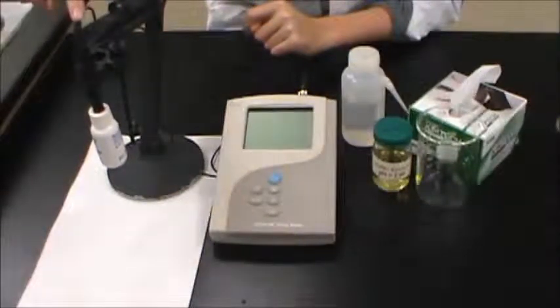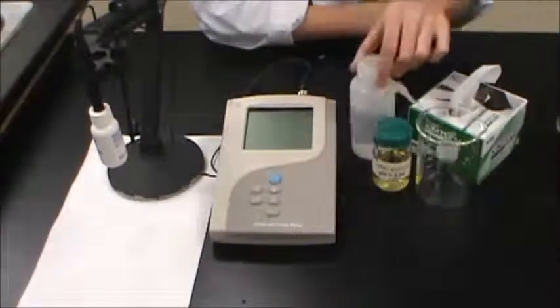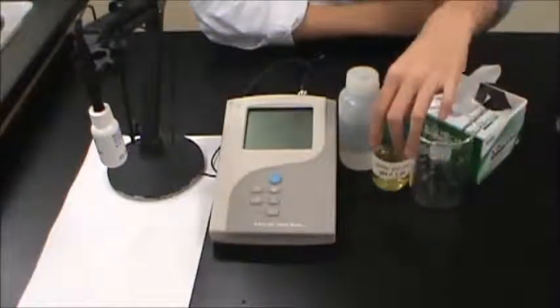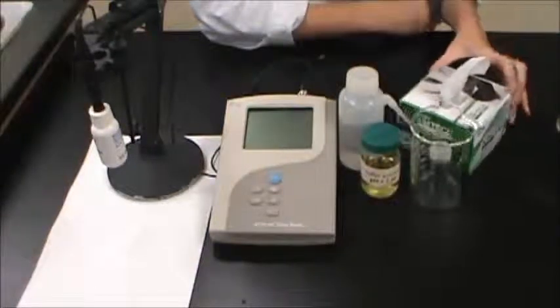A pH meter and stand with a temperature and pH probe, a bottle of deionized water, a waste beaker, a pH buffer solution, and some Kim wipes.